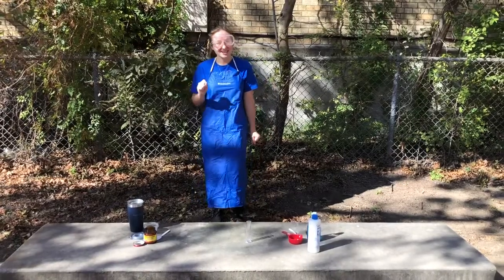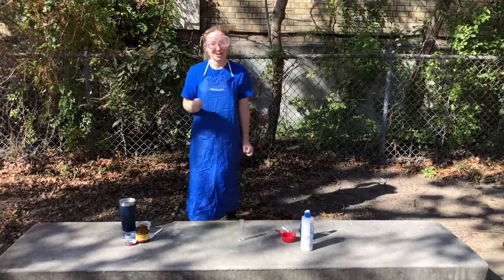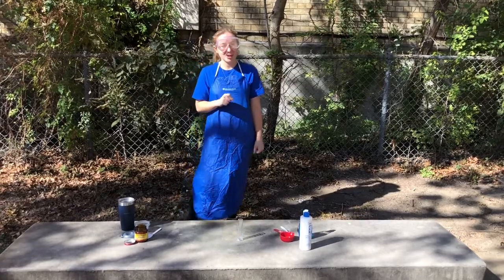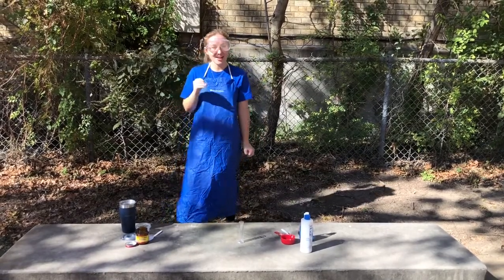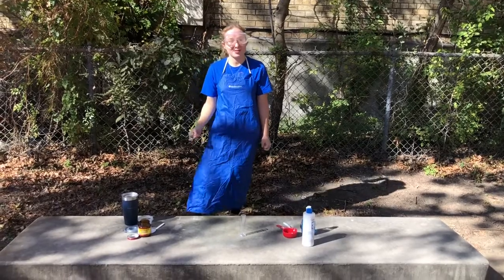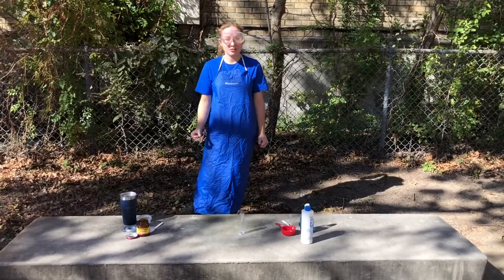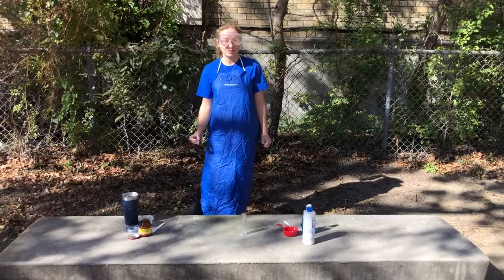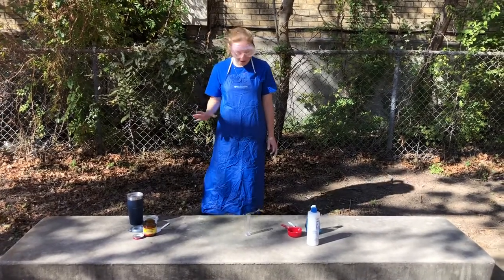This is Sarah Rosenbaum, and I will show you how to make elephant toothpaste. This demonstration shows the decomposition of hydrogen peroxide catalyzed by iodide ions to show the evidence of a chemical reaction. After the demonstration, I will show you how to calculate the bond energies of each species and the total energy change.